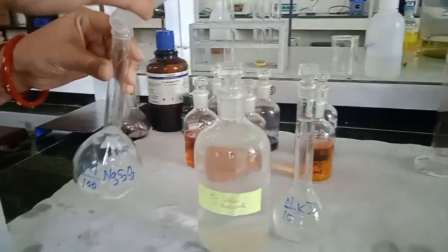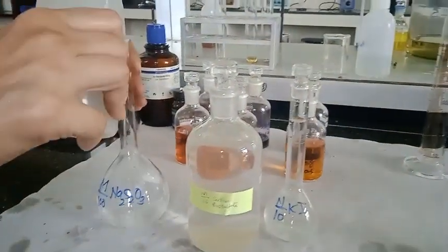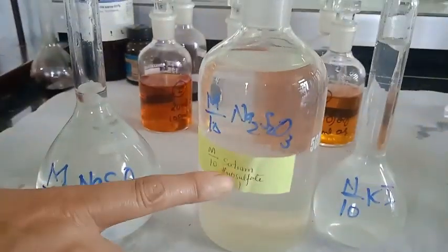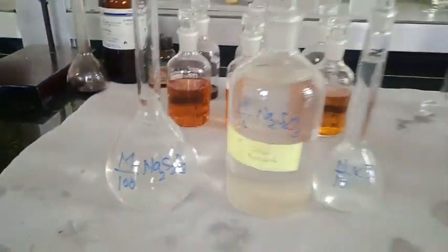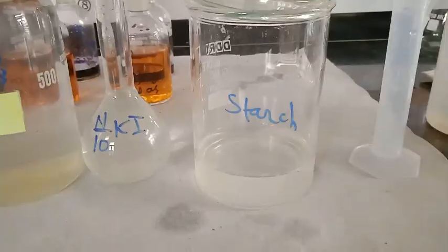So in this manner, we are going to prepare the solution of M by 100 sodium thiosulfate from M by 10. So in this manner we are having three solutions: M by 100 thiosulfate solution, M by 10 thiosulfate solution, and N by 10 KI solution. Now preparing the starch solution.